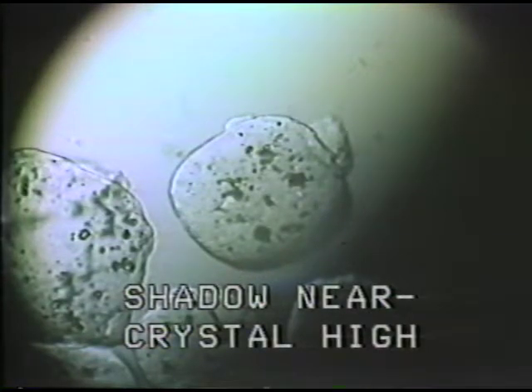and look at the other case of oblique illumination. Here, looking at these grains, you can see that the shadow is on the same side as the shadow in the field of view, or the shadow is near rather than opposite, we say. If the shadow is near, then the crystal is high and the relief is positive.